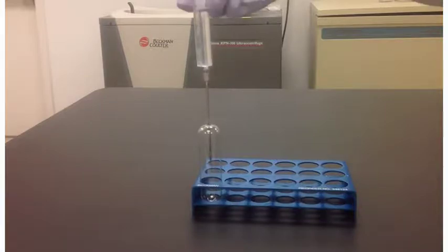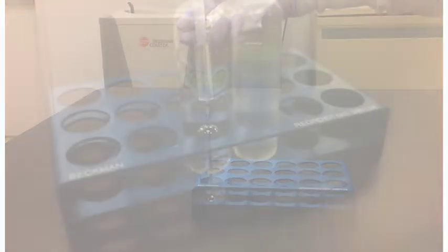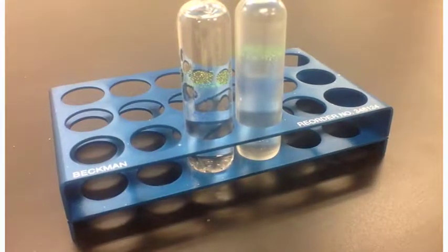Fill each tube to the base of the neck using a syringe with a 13 gauge or smaller needle. Layer the sample onto the tube.